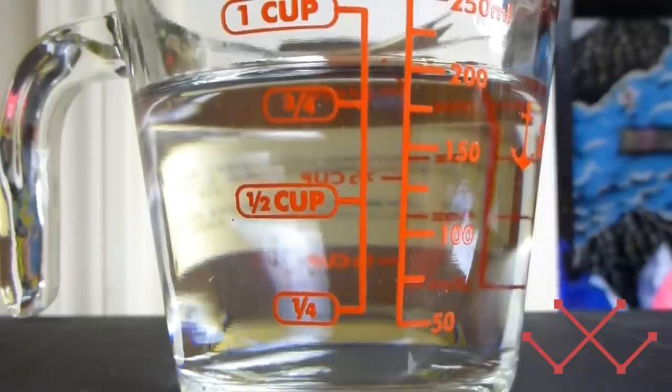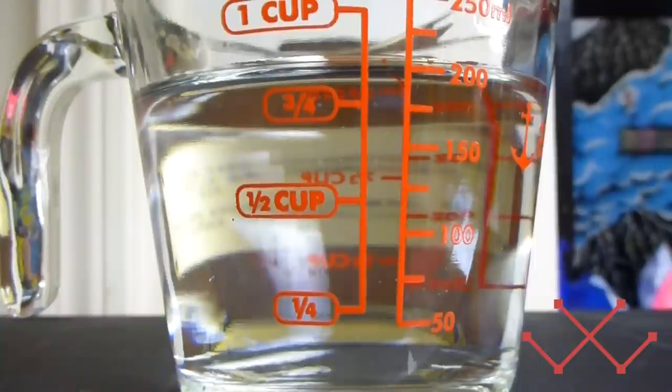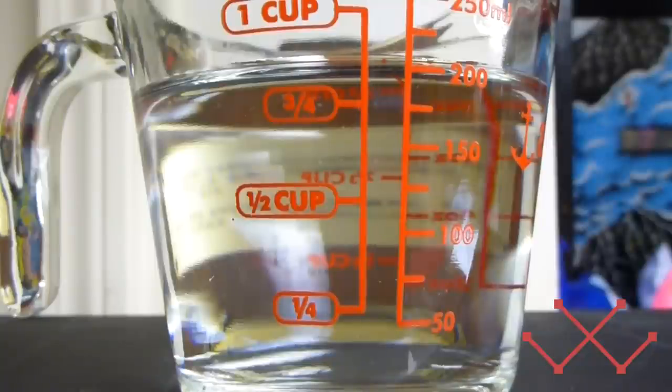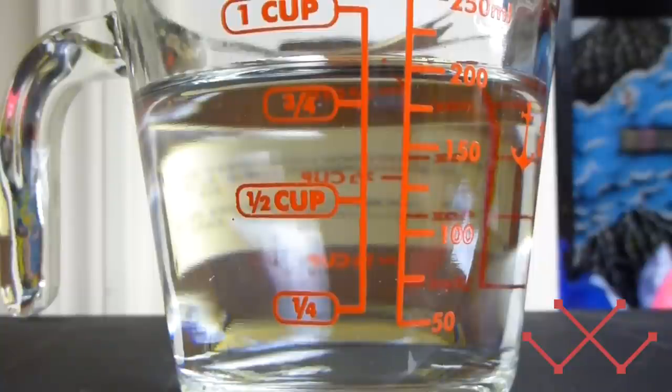Now, what you need to do to make this solution with other concentrations of material is you need to assume that the percentages are volume to volume ratios, even if you don't really know what they are, and you just need to mix the hydrogen peroxide and vinegar in a way that there will be equal amounts of peroxide and vinegar.